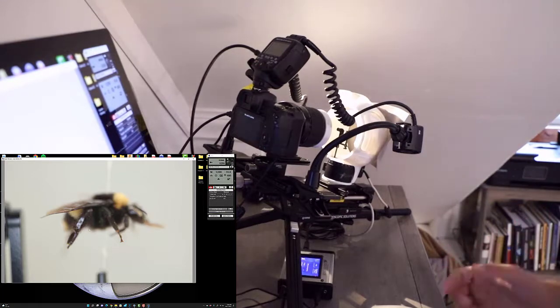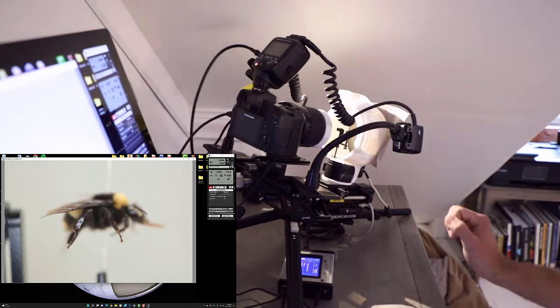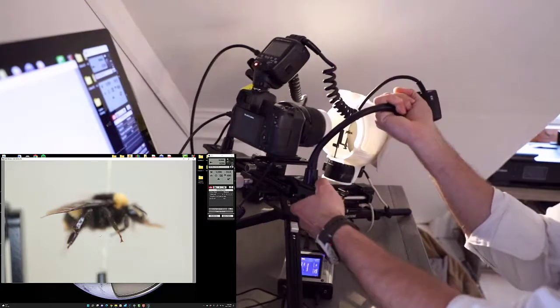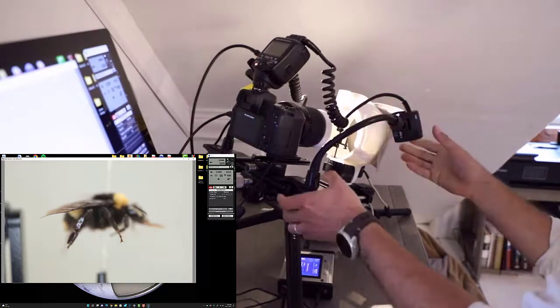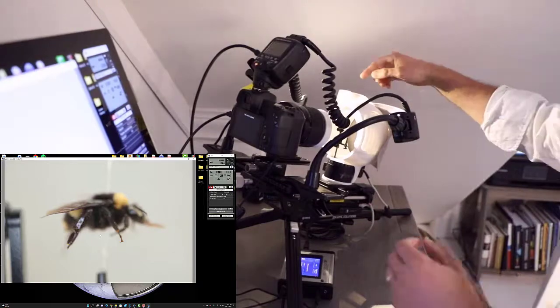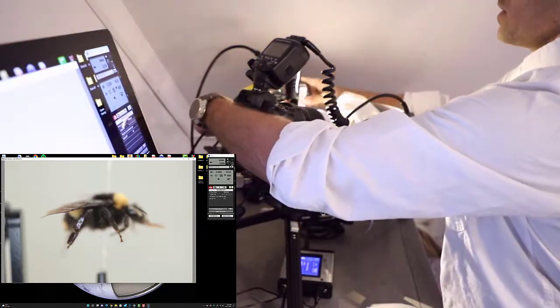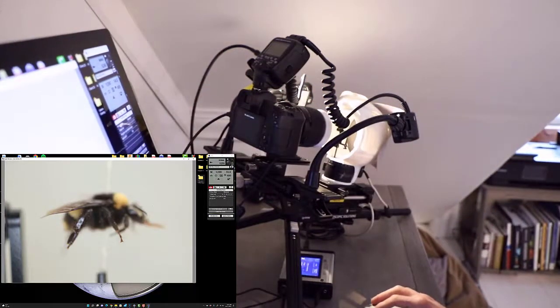So it's not necessarily a bad thing, but of course, let's say that there was important information there that you wanted, and you'd rather not have the glare. We can start to do a couple of things just to see how we can work with this. So the first thing we're going to do is just experiment with moving our flash heads around. So I'm going to move it back a little bit, so further away from the light dome here. And we're also going to move it so that there's a bit more distance between the flash heads and the diffuser. Just try to spread out light just a little bit more.